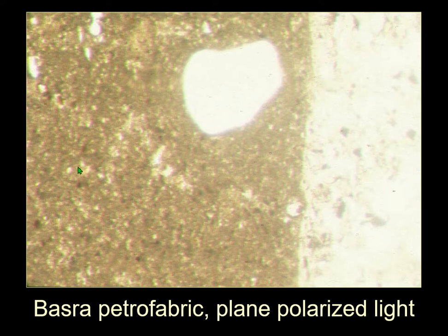But in fact, the absence of characteristics is also a characteristic when every other production center has a lot of stuff in it.